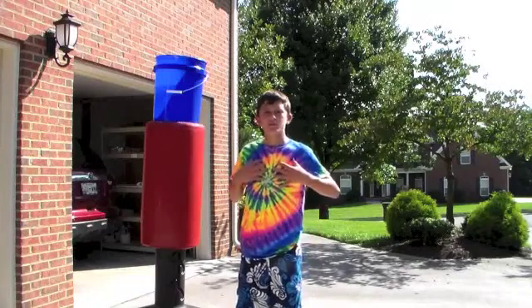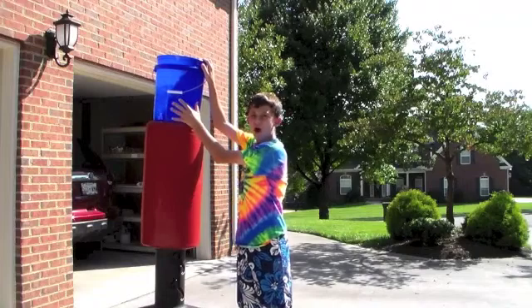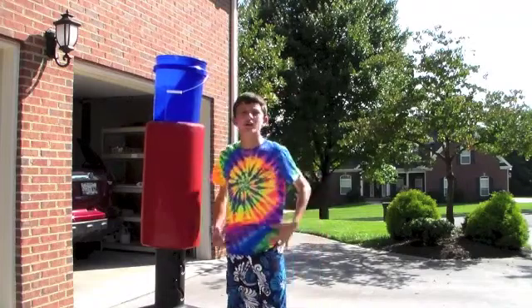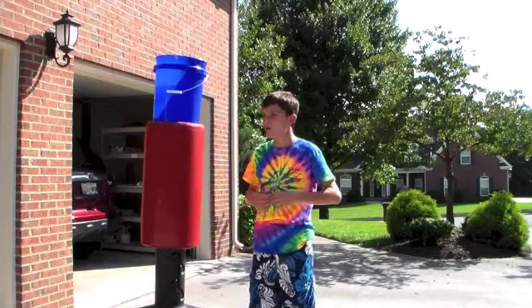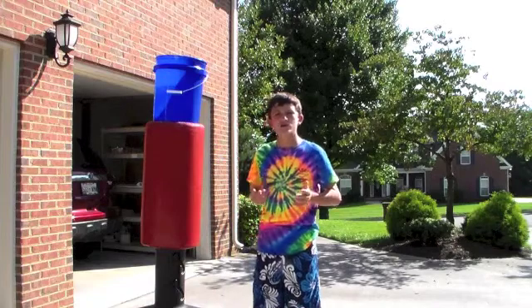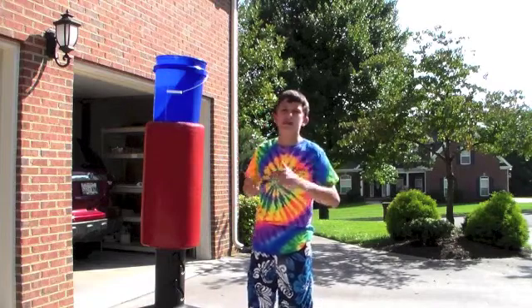The first thing you want to do once you spill a chemical on yourself is come over to your drench bucket. This is just a five gallon bucket full of water. You'll dump it on yourself and get rid of most of the chemical really quickly and effectively. Because I'm going to be using fake sulfuric acid, I'm going to first neutralize it with baking soda solution, but that's just because it's an acid.